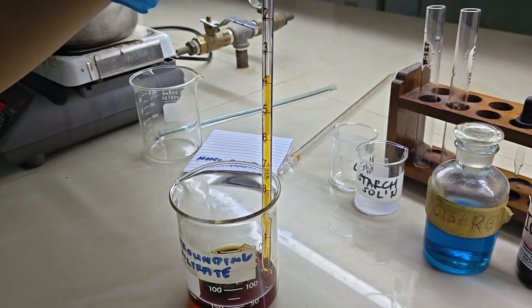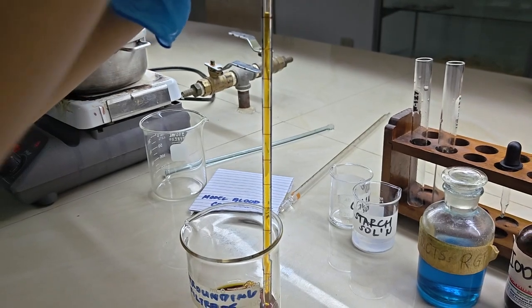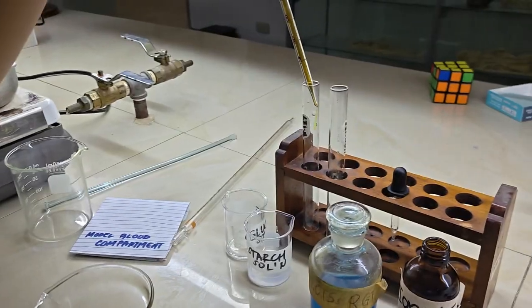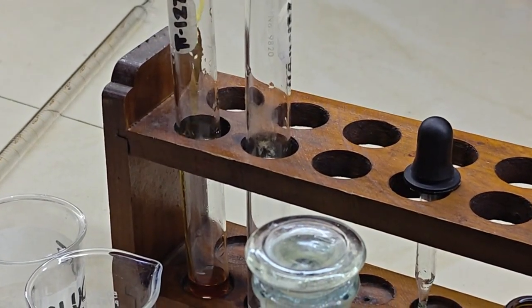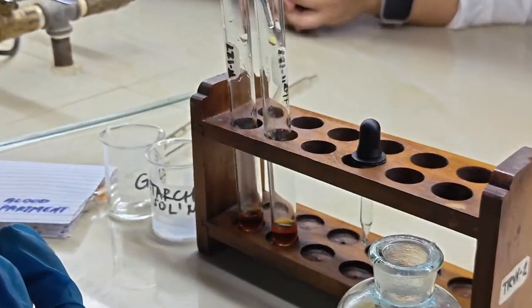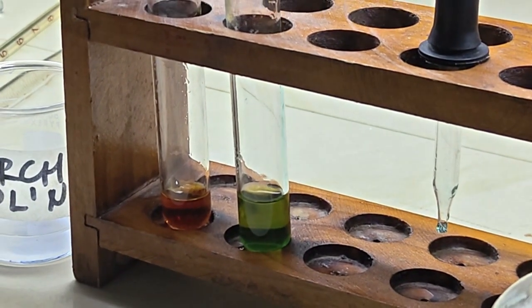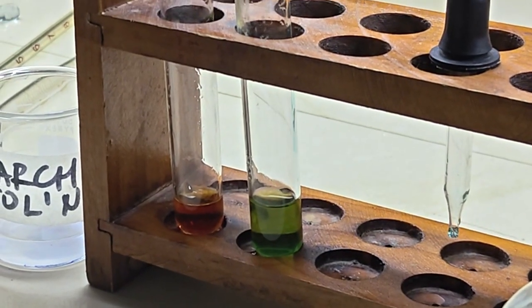Next, we have to test if any glucose molecules from inside the bag crossed into the outside solution of iodine. To do this, I had to take a small amount of the outside solution and put it into a test tube. Then, I added an equal amount of Benedict's solution. The initial green color does not yet indicate a reaction, only that the yellow and blue pigments from each substance mix together.